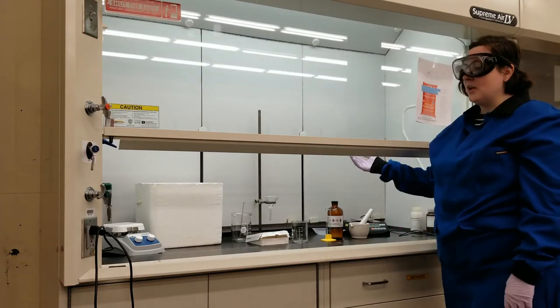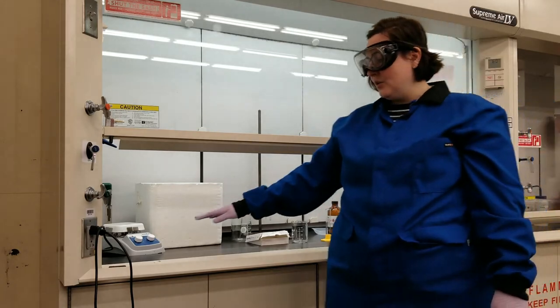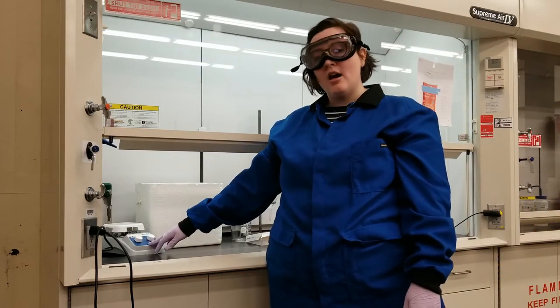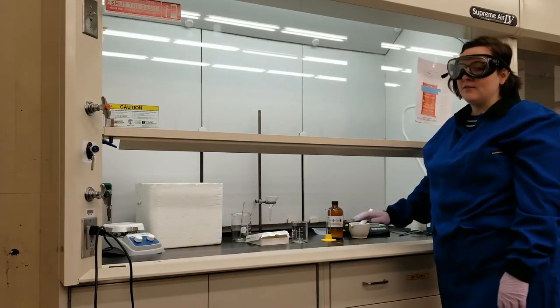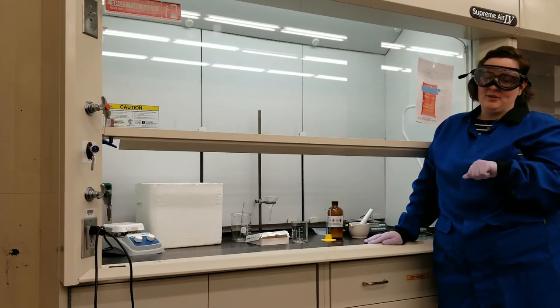I'm going to be doing all of my work in a hood because I'm working with hexane and I don't want to inhale the vapors. When I do heat the hexane, I'm going to keep open flames away from it. I'm going to gently heat it on a hot plate, and even though I am using food in lab today, I am not going to eat any of the food or take the bag with me afterwards for lunch.